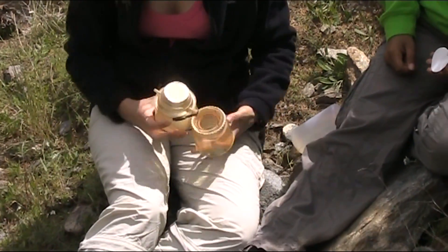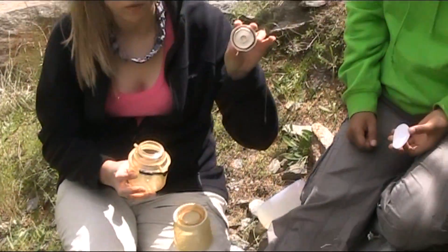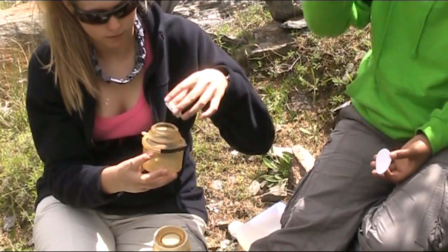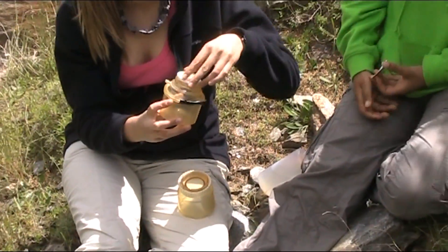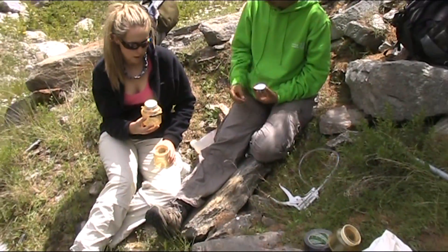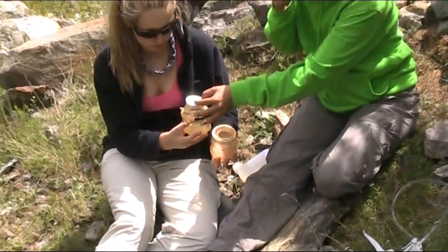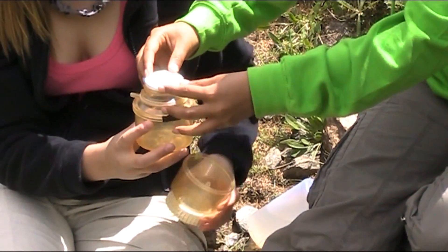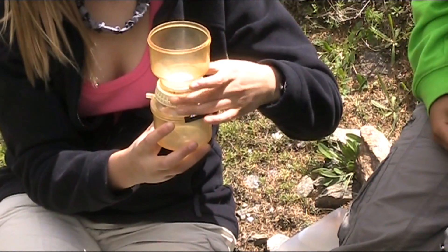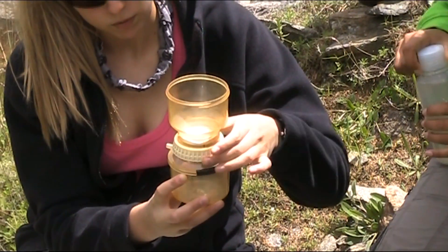On the lower half of the housing, underneath the white plate upon which the filter paper rests, there is another rubber ring — again Rachel is just pointing this out — you have got to make sure that is there. Otherwise you won't be able to create the vacuum that we need to filter the sample. The next job is to take the filter paper and place it on the lower half of the housing. It can be a bit tricky in the wind so you need to keep a hold on it. Then carefully screw the upper part of the housing in place, making sure you don't cross-thread the plastic collar — it's quite easy to do.